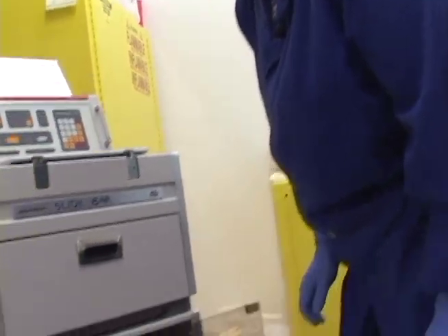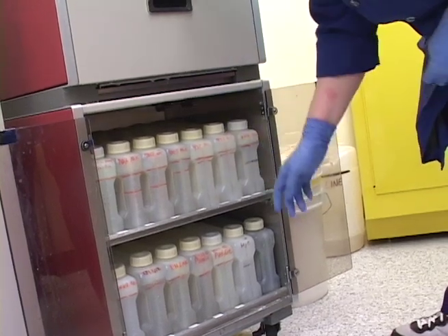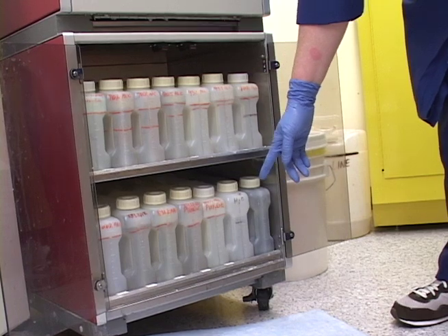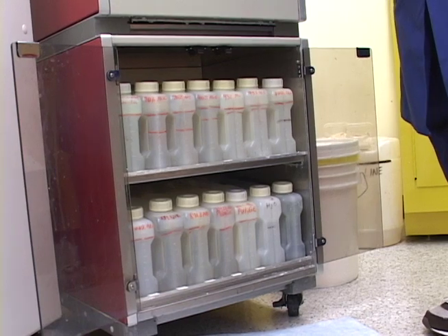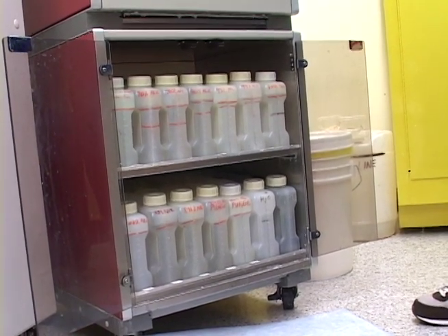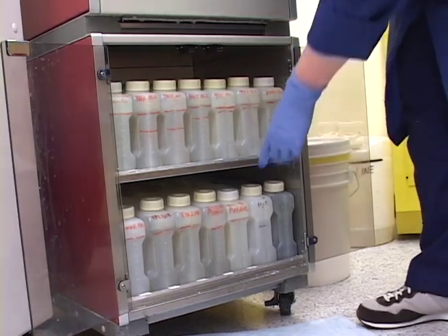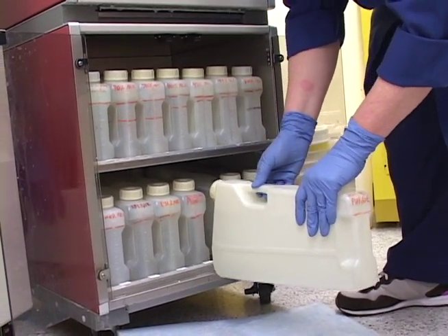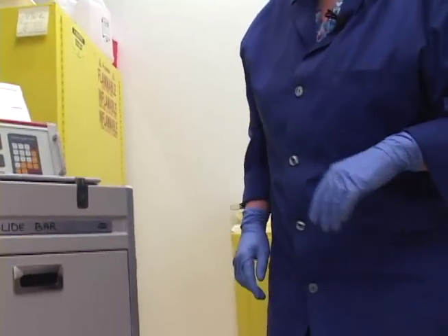The next thing I'm going to take out is the 100% alcohols — slots seven, eight, and we have a purge 100% alcohol. For this purge 100% alcohol I can use bulk alcohol from the dock, so there's no sense wasting our good reagent alcohol that we pay extra hazardous shipping for, since all it's doing is cleaning the machine — pumping in and out to get all the extra stuff out. So we use the bulk dock alcohol for this one. I'm going to take it out slowly, bring it down, let it drain, and bring these into the lab area to dump them with running water.